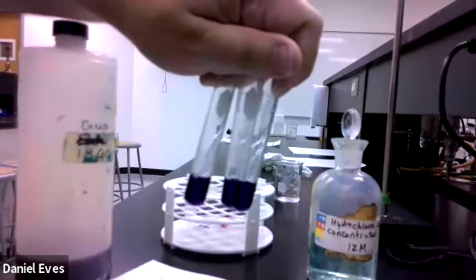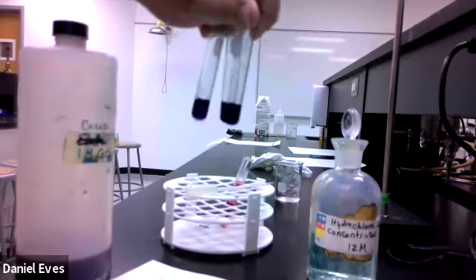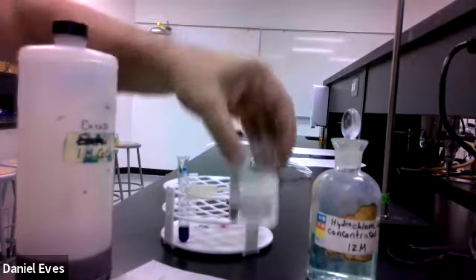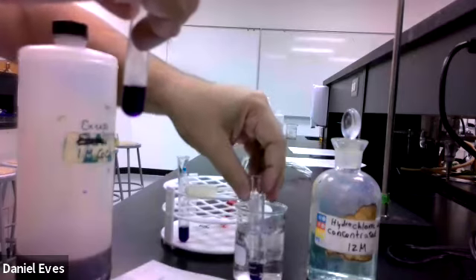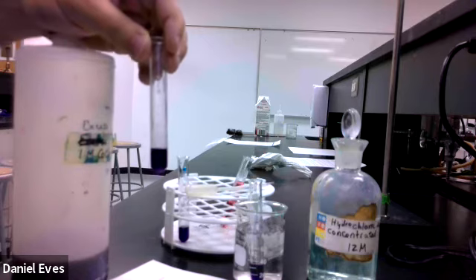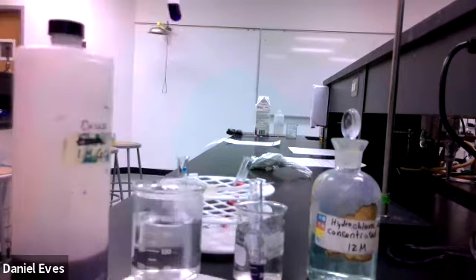Okay, so here we have 3 test tubes with the various colors, and we're going to set them into different situations. So here we're going to leave the room temperature one. Here we're going to take our ice bath, and then over here I'm going to go grab water that's been sitting on a burner, and it's above 50 degrees, so I'll just go grab that real quick and turn this off. So this water right here has been on a hot plate, and it is very warm. So we're going to go ahead and set those all right there. And so this is our room temperature one, this is our heated one, and this is our cold one.